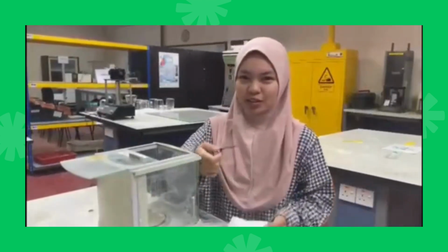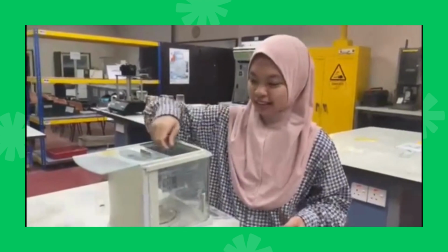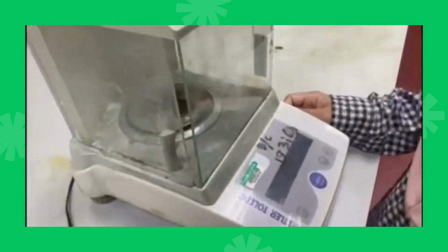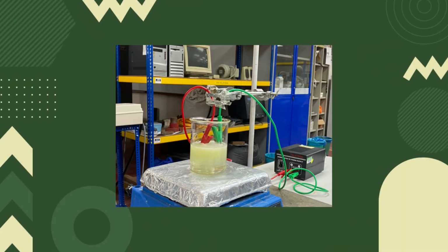The plating, we will measure the weight of this material. First of all, as we can see in the video, we have two alligator clips. The red alligator clip, we put the 10 cent coin as anode and place it on the positive side of the power supply. Meanwhile, the alligator clip in green is the cathode, where the materials will be changed after one of them has been completed. The materials are copper, aluminium and iron, and this clip is connected to the negative channel of the power supply.